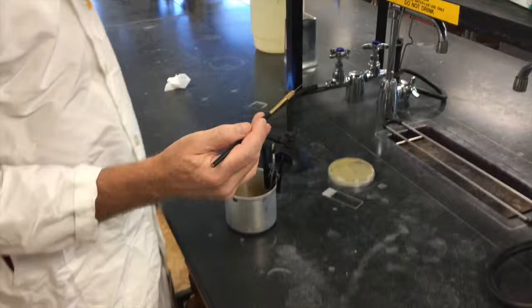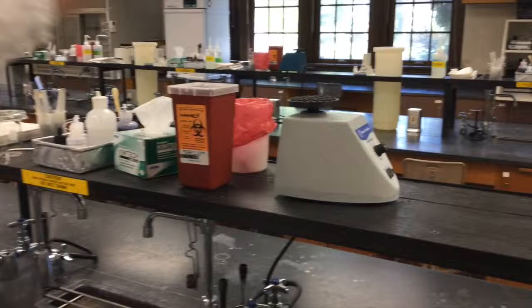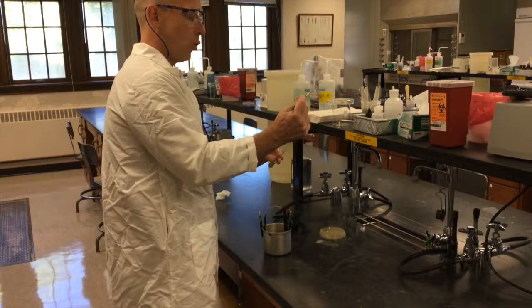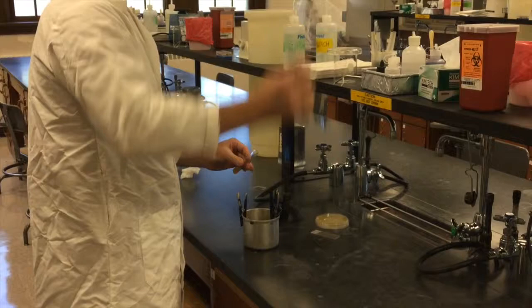We're going to take our sample aseptically, first from the broth. Usually it's a good idea to quickly give a little mix before you go in. Working aseptically, meaning hold your loop like a pencil that leaves your fingers free, what you want to do is grab the lid at a slight angle and open it up by the flame. So you have a slight angle so nothing can get in very easily. You're right by the flame so nothing can fall down except positive pressure, warm air. And the cap is not touching the ground and it's upside down so nothing can fall into it.